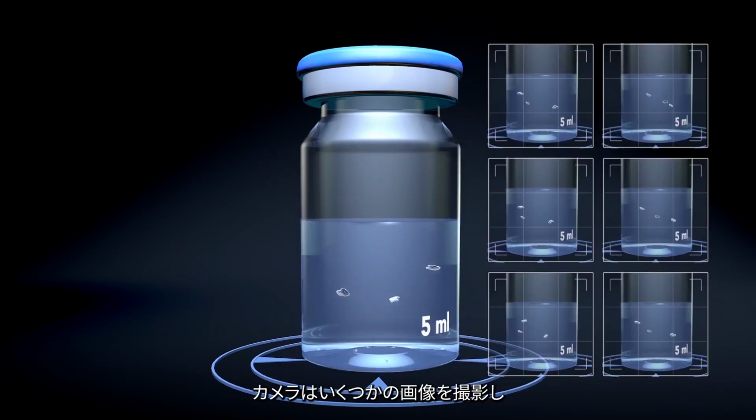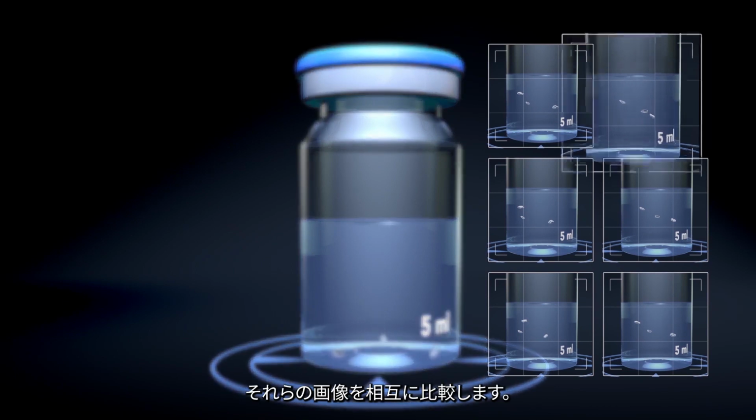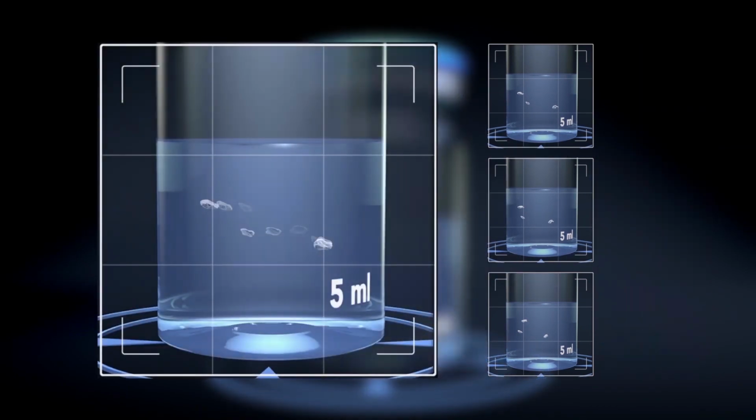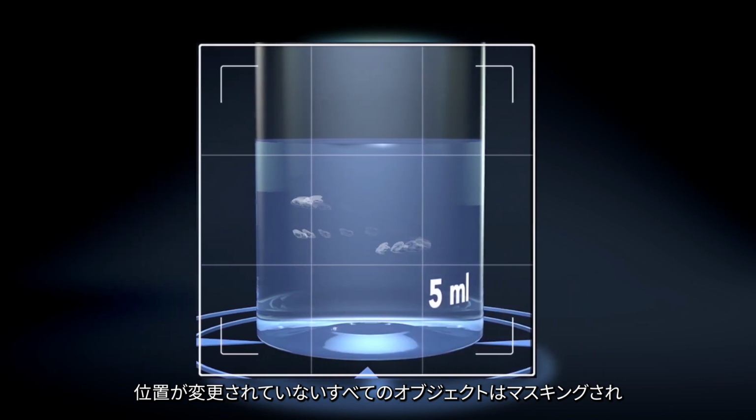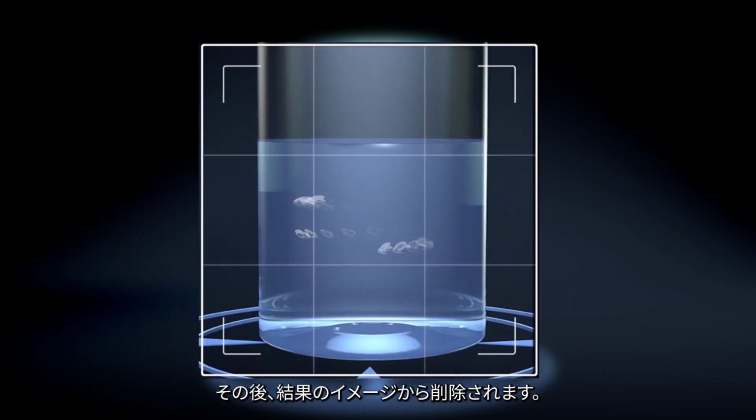A camera takes several images which are then compared to each other. Every object that has not changed its position is masked and subsequently deleted from the resulting image. What remains are the objects which have changed their position from one image to another, the particles.